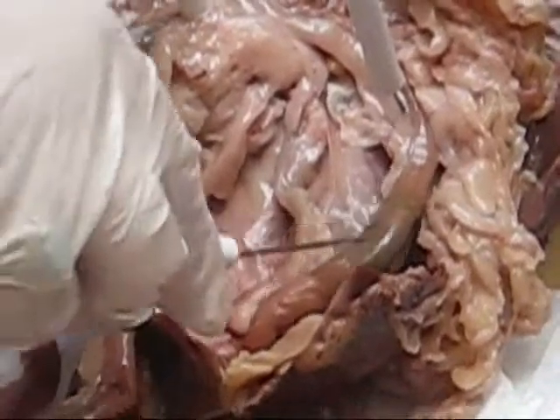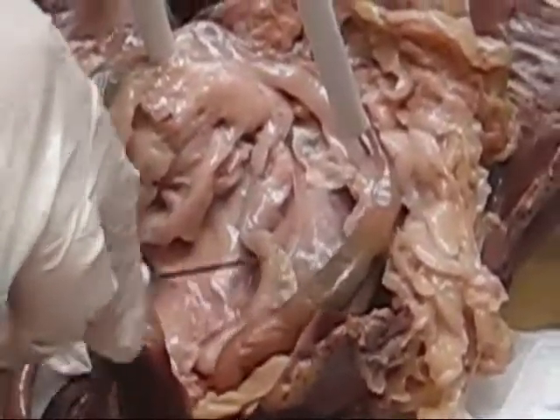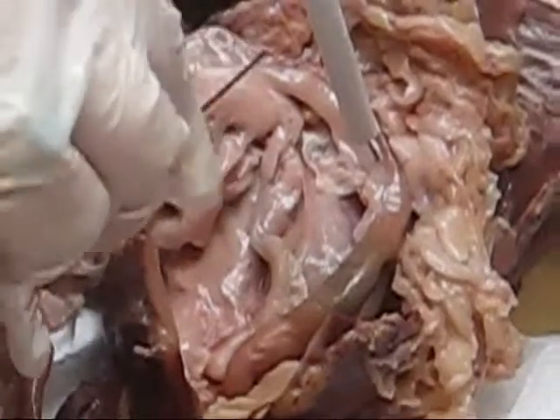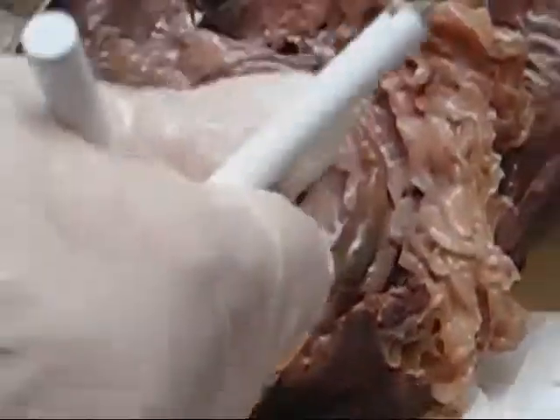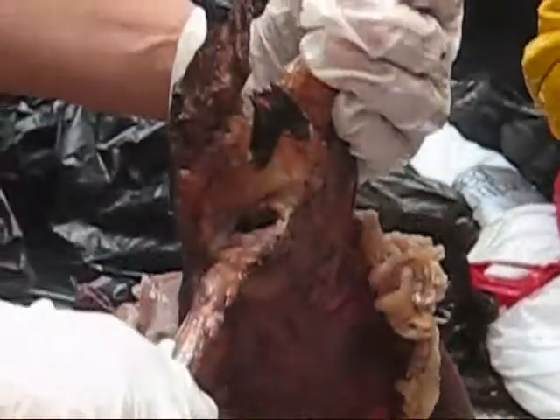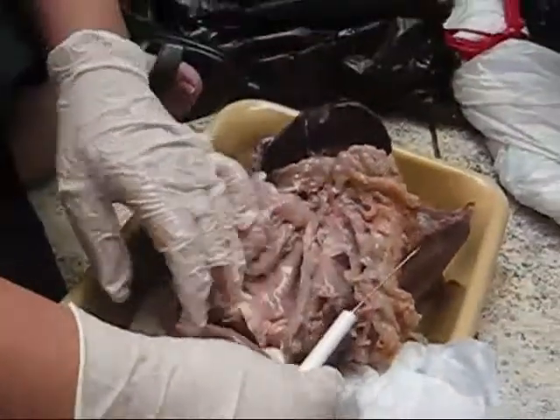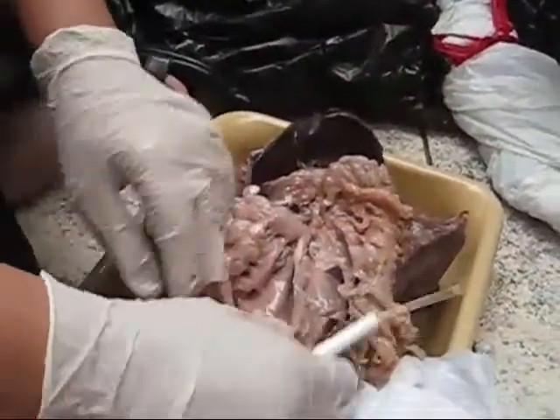What's that green stuff in it? Probably something that's in there. Okay, we're done with the intestine. By the way, the anus is underneath the tail — on the other side, underneath here, is the anus. All right, now we're going to take a look at the kidneys.